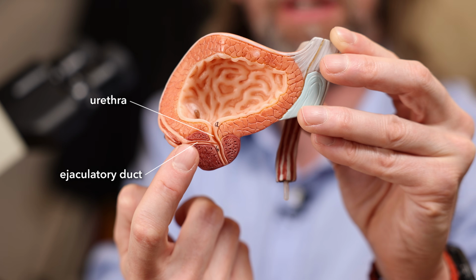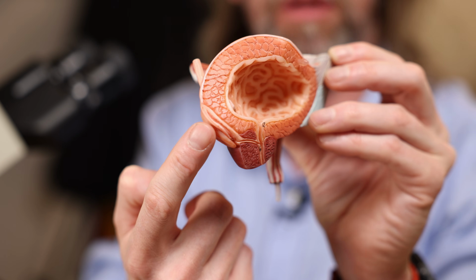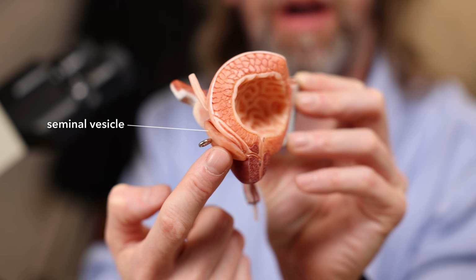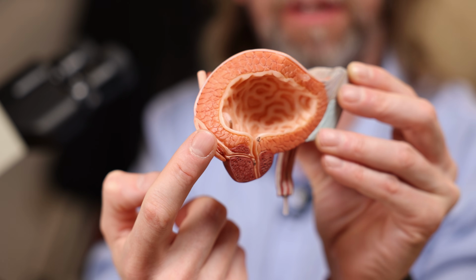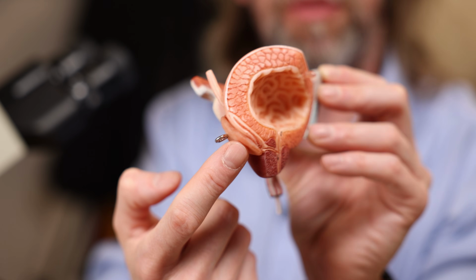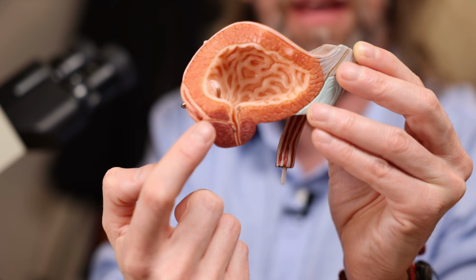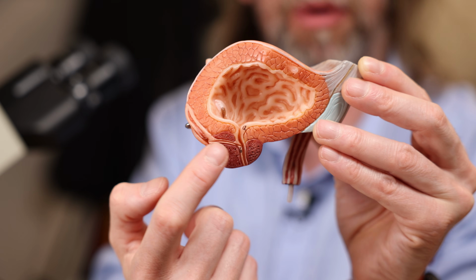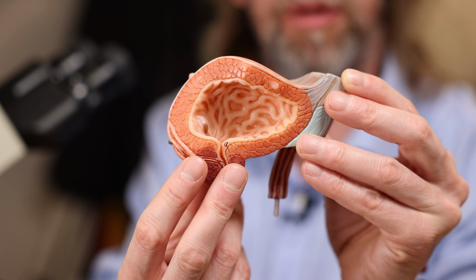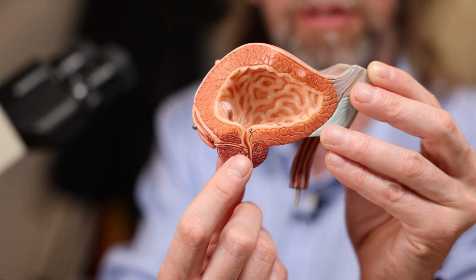And then we can also see the ejaculatory duct here. There's the seminal vesicle on the posterior part of the bladder there. And that is going to duct into the ductus deferens, so mix the components of the seminal vesicles with the spermatozoa as they pass in. This all happens during ejaculation, and that gets passed in from both sides into the urethra. So we're looking at this tissue when we look at the prostate, but we're going to be looking out for the urethra because hopefully the urethra is going to be in there somewhere, right?